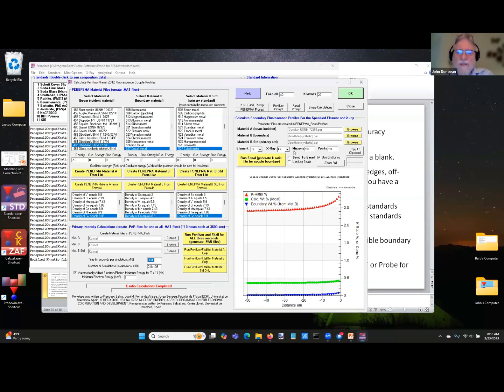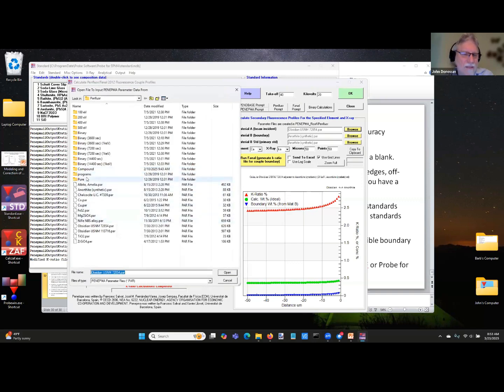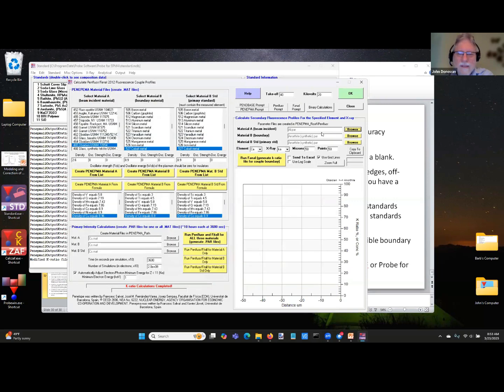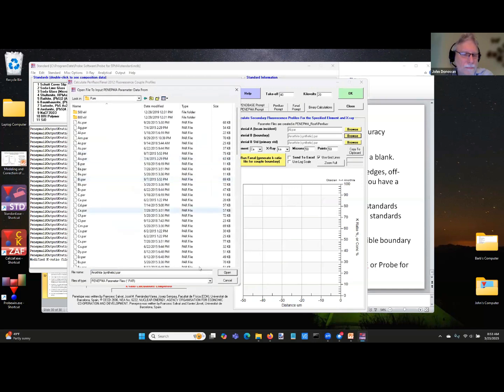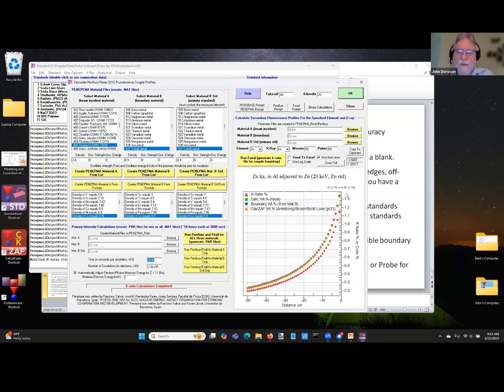Like I said, the one that was really amazing was the zinc aluminum one, and that was just wild. So if I go here and look at the beam incident material, it's pure aluminum, and it's adjacent to pure zinc, all the way down to Z. And we'll just use zinc as our standard, and then we'll look at zinc and we'll measure it. You might be able to find a situation where it doesn't have much of an effect, and I'll demonstrate that for you. So here we're getting about a 1.3 weight% effect.